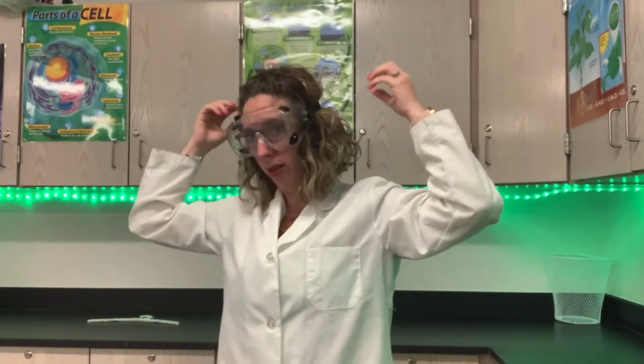Okay, so first, oh, wait a minute. I do not have on any lab safety equipment. Give me 1 second. Okay, that's better. Don't I look nice and stylish? Not really, and my glasses are squished against my face with these goggles on, but oh well. It is what it is. Here we go. Let's get started. So I am all lab safetied out and we're gonna get started here.